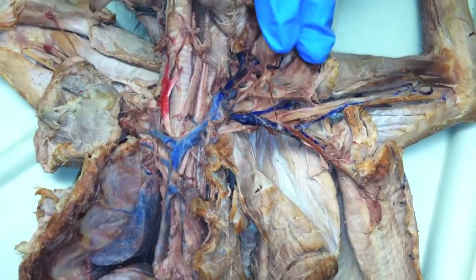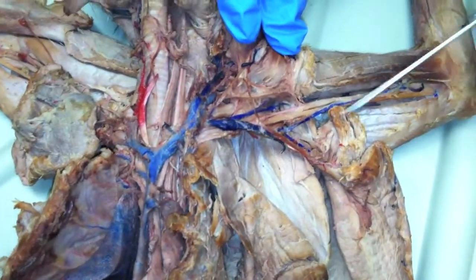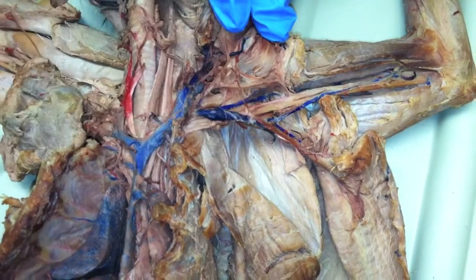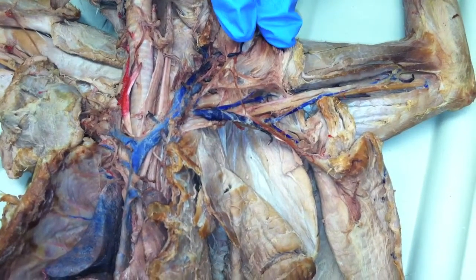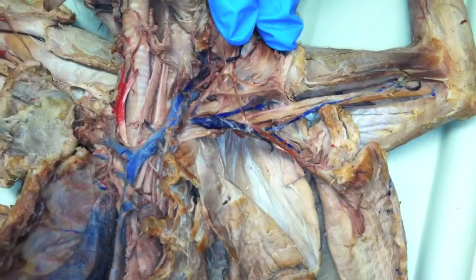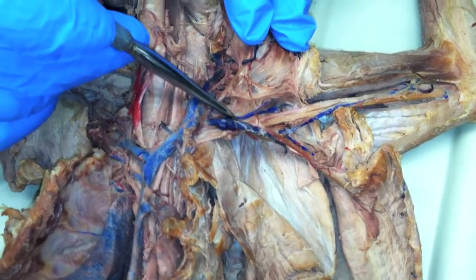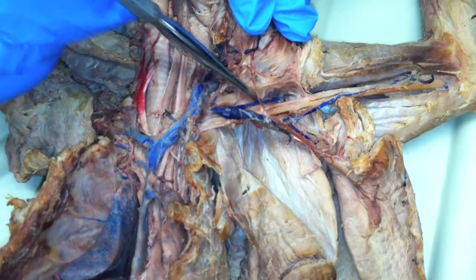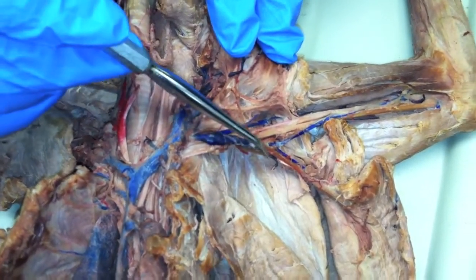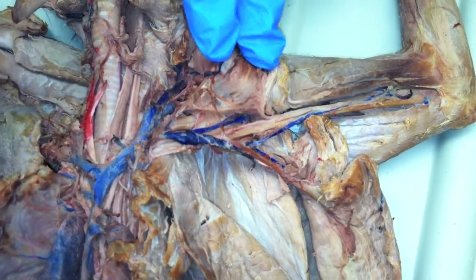And where's our subclavian vein? That one there — that's just that little part right there, little piece. So then what's the next part of it? Axillary. What's this one branching up from it there? I'll use this. Subscapular — this one here. So that's subscapular. So once the subscapular branches, or comes into it, you have axillary, subscapular, then becomes your subclavian.